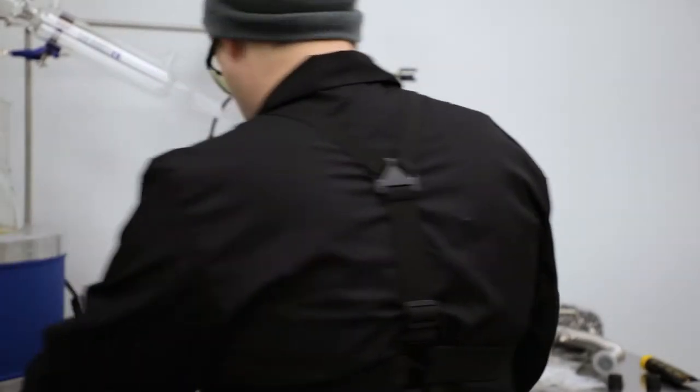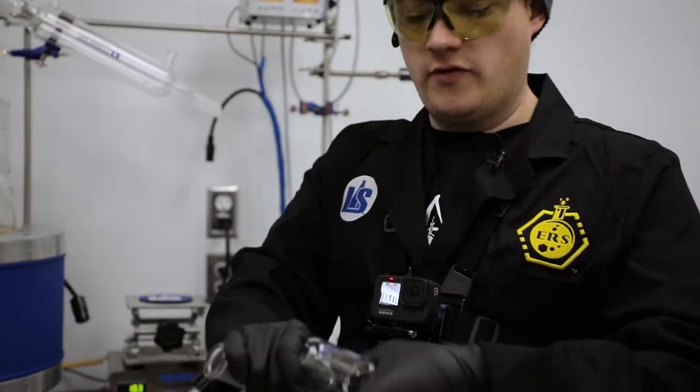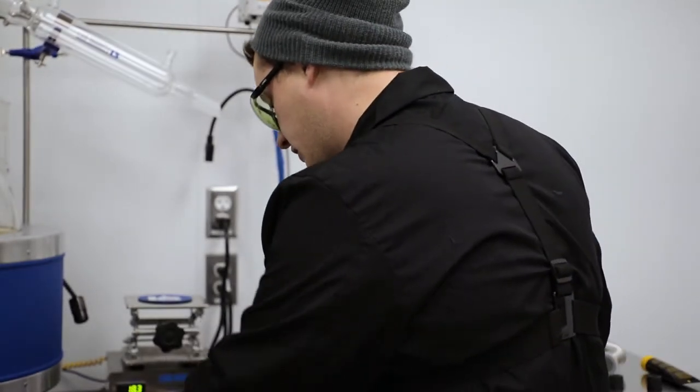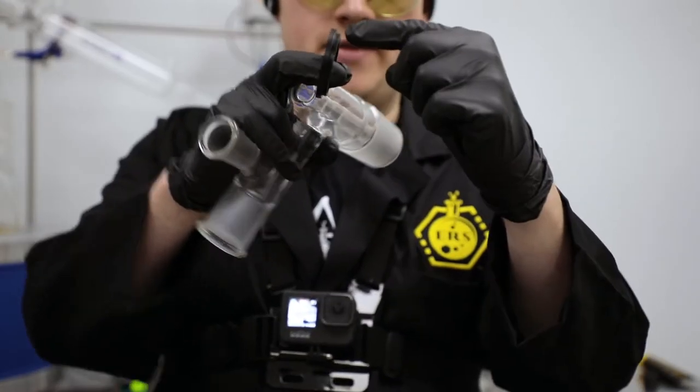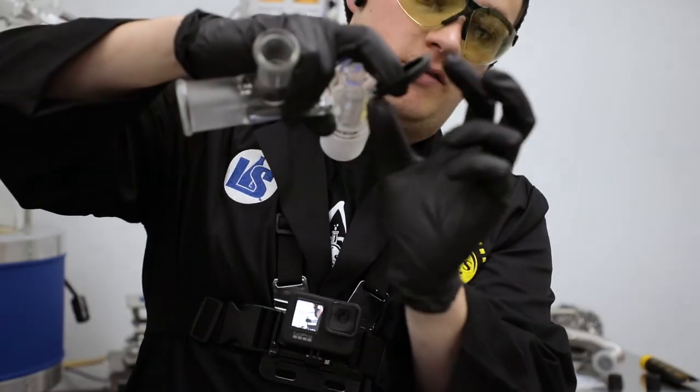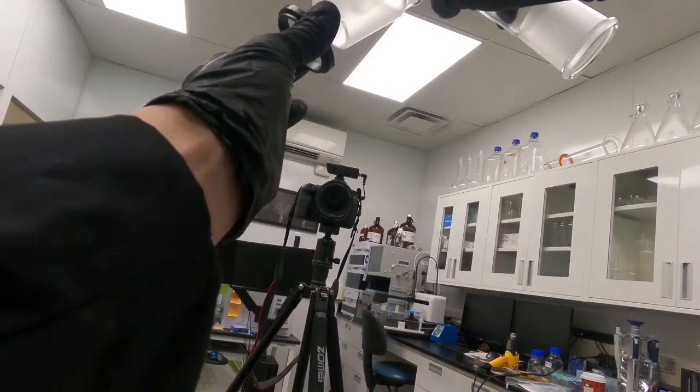The order in which we're going to assemble a Rotavis stopper is first the black step ring, which we always want to make sure that this part is facing down—the smaller side is downwards, so just like this.